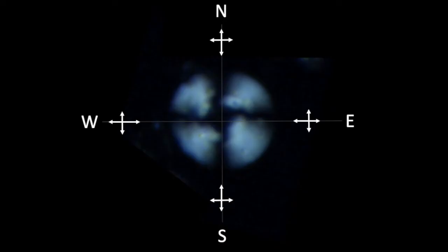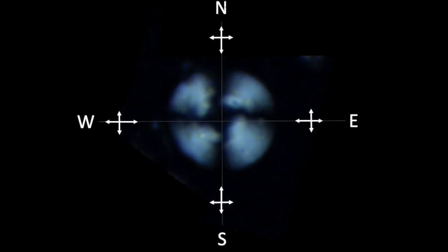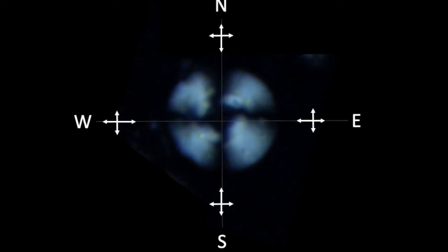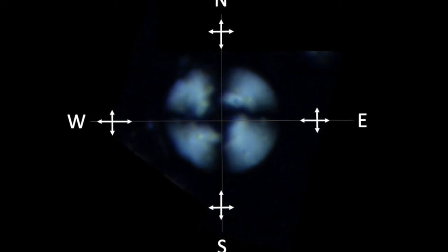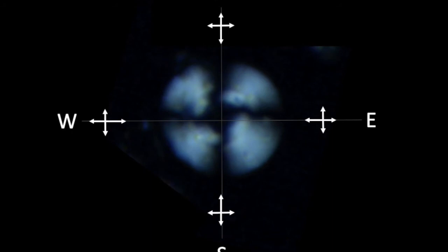Okay, let's consider this round calcareous nanofossil composed of a series of single crystallites, the so-called elements, disposed radially. Some are illuminated, some others aren't. The ones that aren't illuminated have their special directions, the optical ray direction of the extraordinary ray and the perpendicular direction of the ordinary ray, aligned with the polarizer and analyzer. And so, they don't rotate the light and become extinct under cross polars.